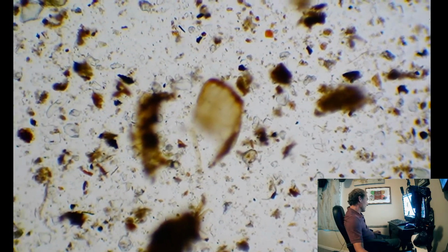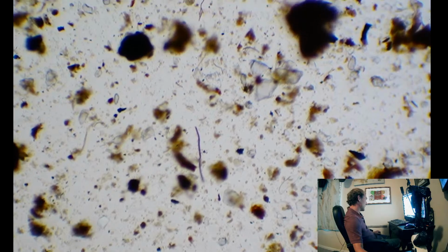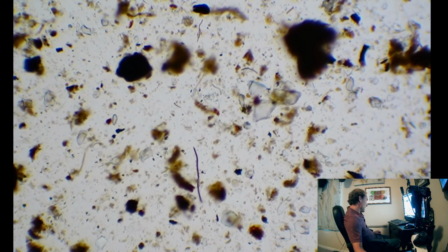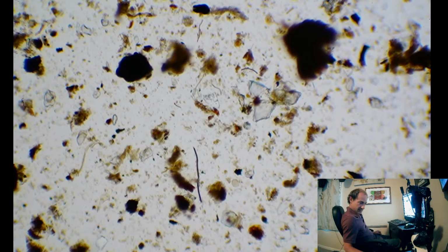So we took a sample right under the infected sorghum, and we're seeing some fungi strands like this, but not exactly what we would like to see. I mean, it's a decent amount. We're seeing another little piece up here. We are at 100x magnification.